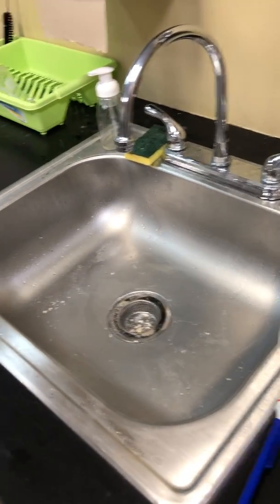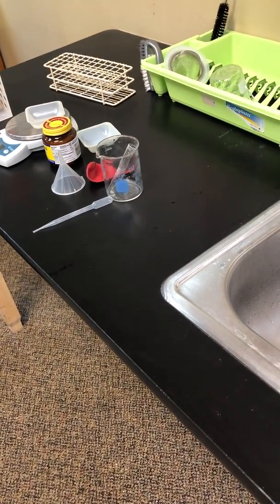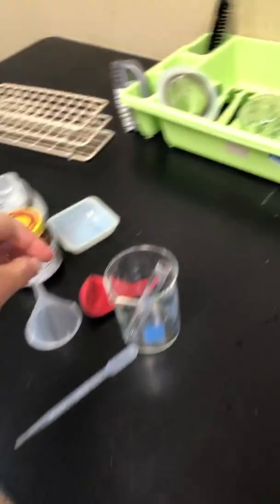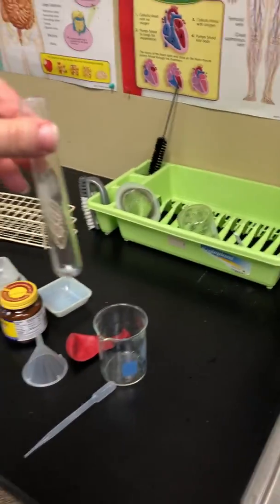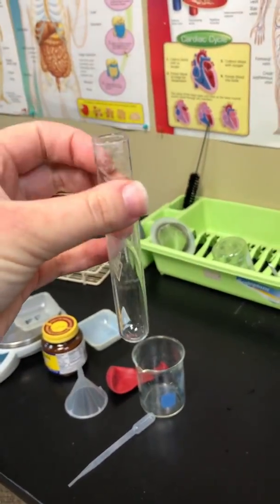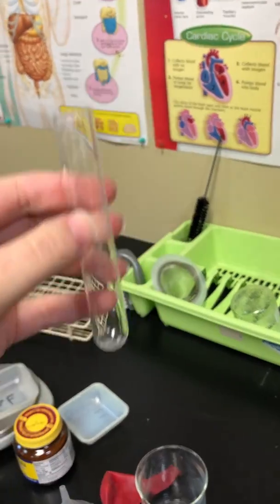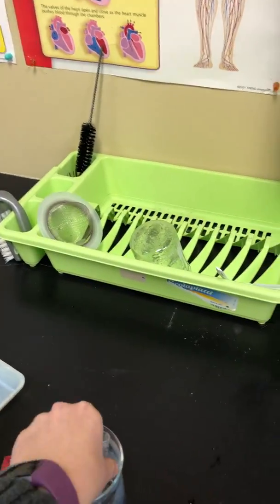So let's start with setting up your test tube. The first thing you want to do is set up what's going to go inside your test tube. So here's a test tube. You can see this one didn't get cleaned very well, so we're going to talk about cleaning before we finish the video as well. So here's the test tube, and I need to fill it up with the type of food that I would like to test. So let's go over and look at your options for that.